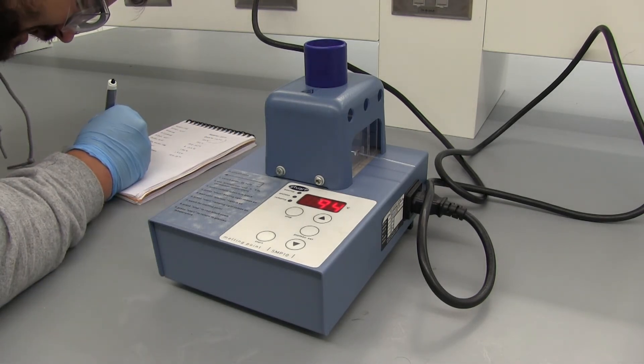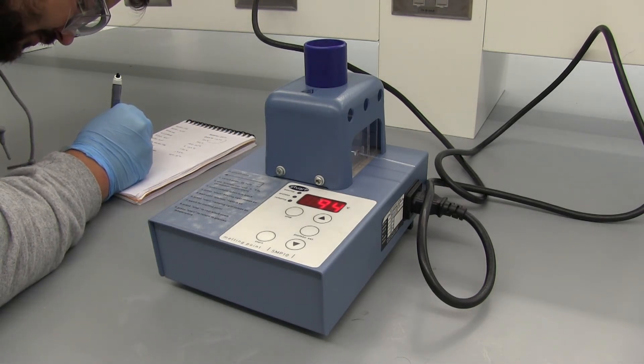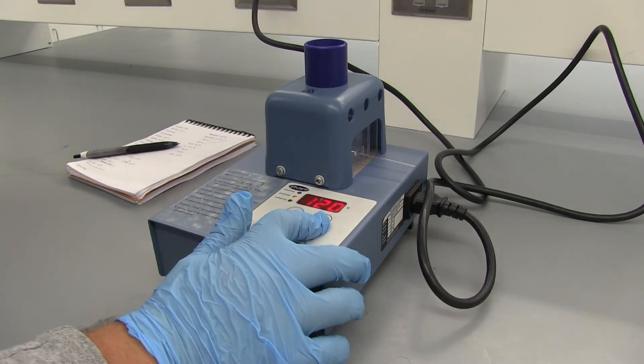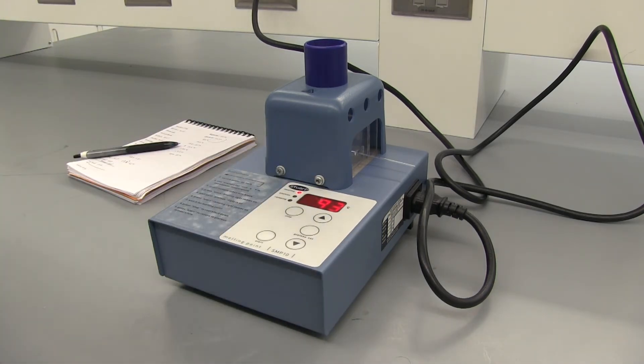So this time it is with benzoic acid and I have the plateau set to 120 again and I'm just going to press start.